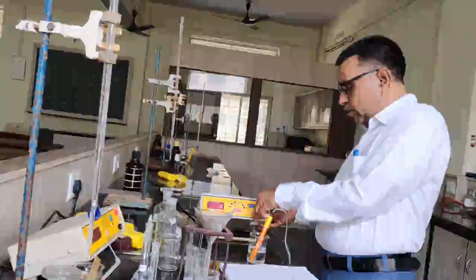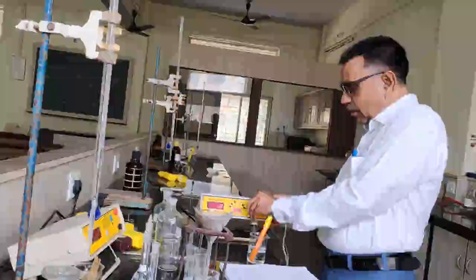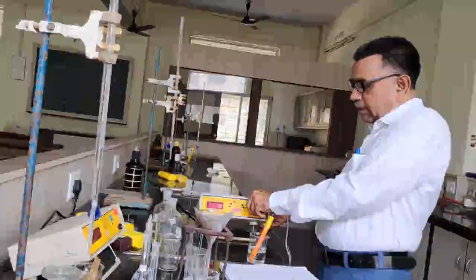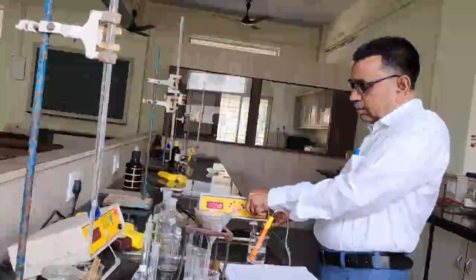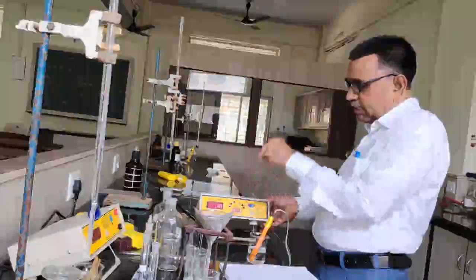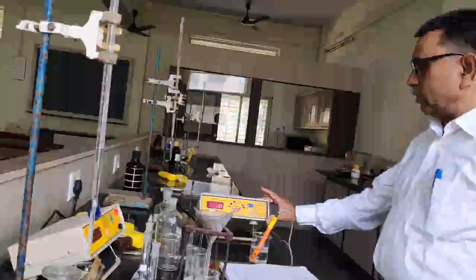If the instrument shows the reading 1.00 in the standard condition. So I would like, by moving this knob here, the conductance should be 1.00. So you can see here the conductance is equal to 1.00. Now the conductometer is in the standard condition.